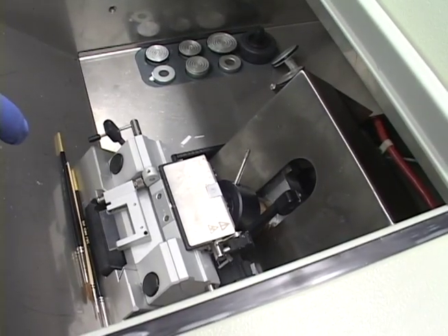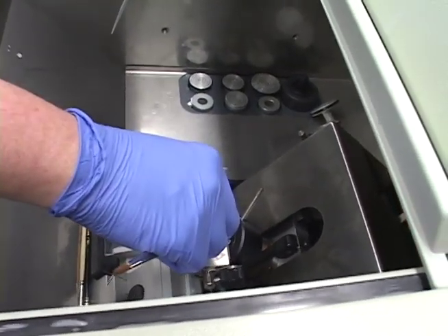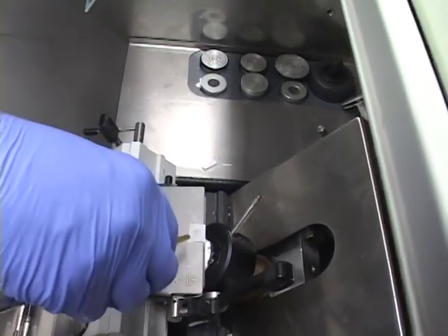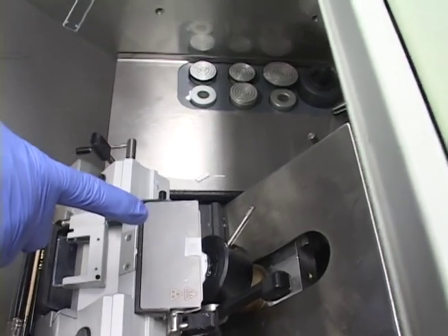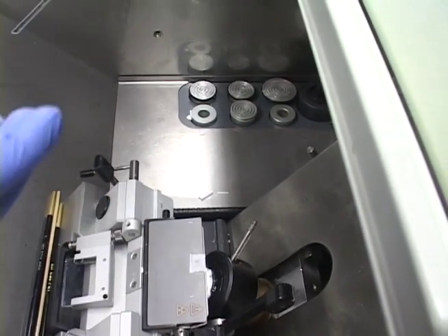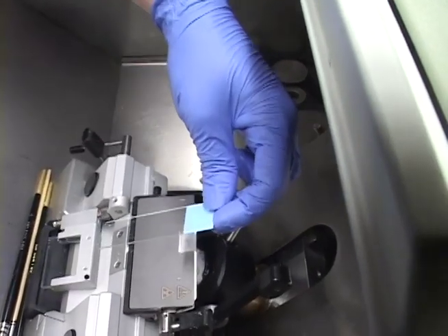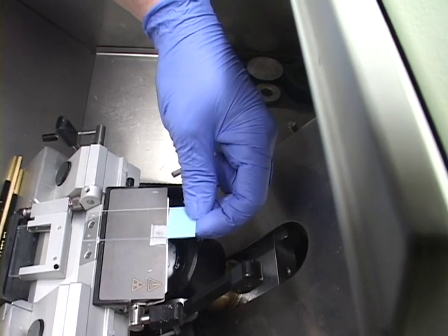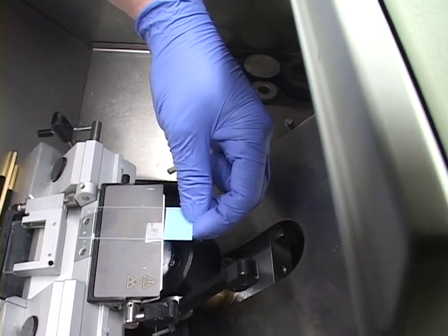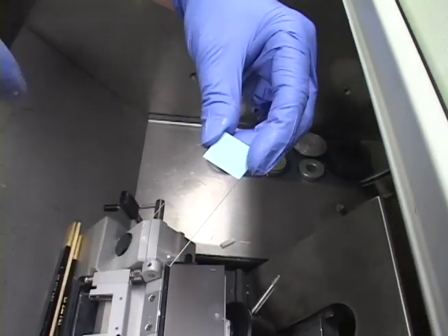We can just pick it up with a slide. I like to touch it down with a touch of frost or just a touch with the end of a brush — that gives me full control over picking it up so it doesn't hop onto the slide. It gives me more control so I can position it on the slide wherever I want. So now I want to do several rows.